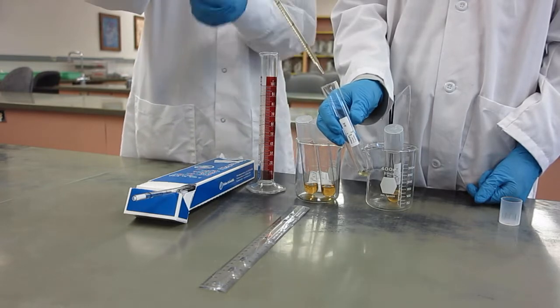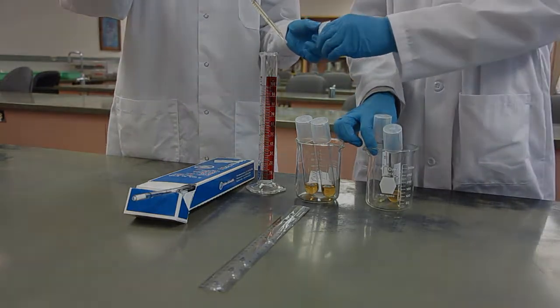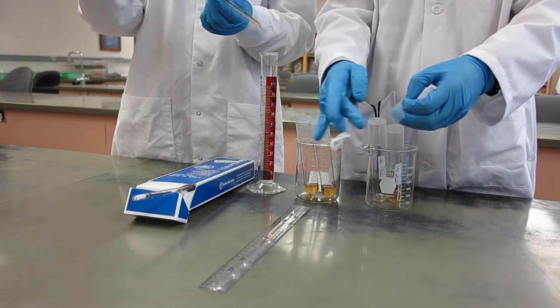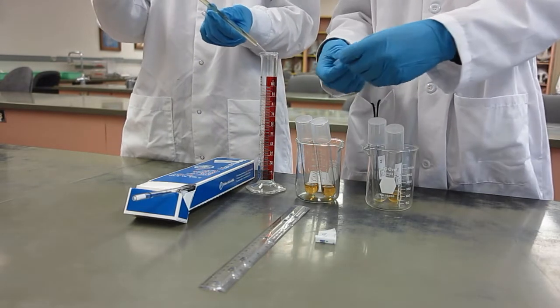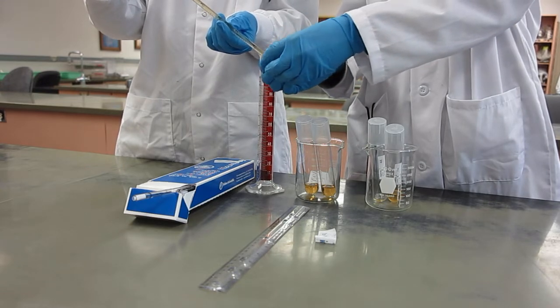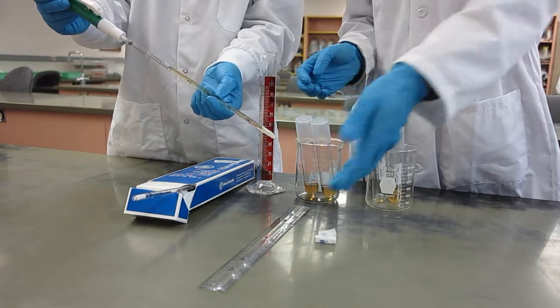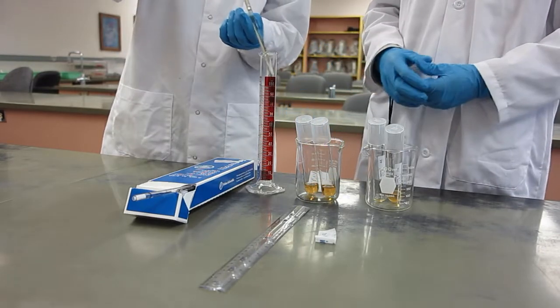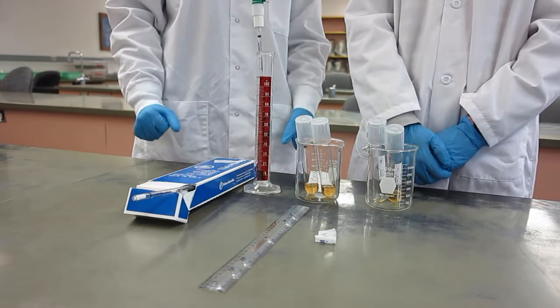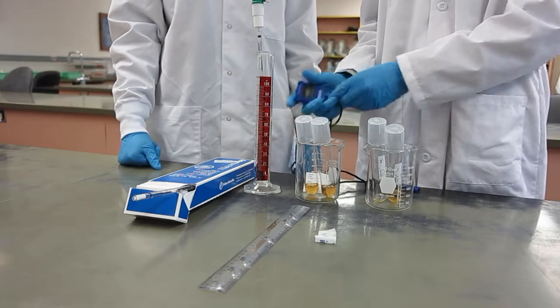Make sure you put it in the appropriately labeled tube, in this case, A. Seal the bottom of the glass pipette with a piece of parafilm, and allow the pipette to stand upright in a glass cylinder or flask for 10 minutes total. Use a timer to keep track of the time. Make sure the media is not leaking out.